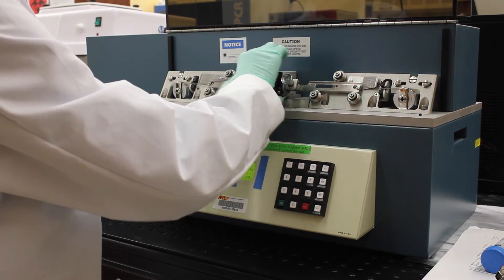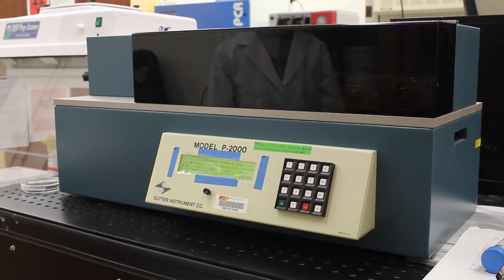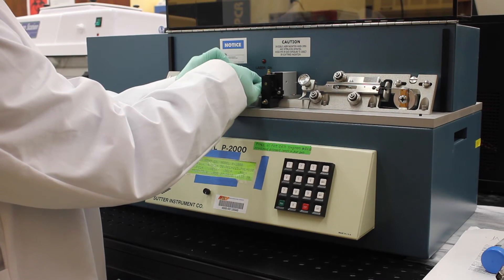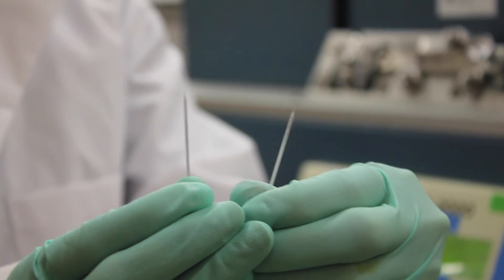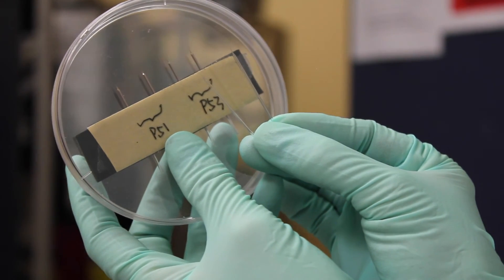You need to make sure it is in place. Then close the lid because there is a laser inside. Now the laser is on. For around one minute, you will hear a loud sound. At that moment, it means it's ready and you will see the laser light turn off. Now you can open the lid and you get two glass nanopipettes. You can see the tip is very sharp — as shown before, around a few hundred nanometers in size. Within one to two minutes, we get two glass nanopipettes. If you want to make it SERS active, you need to deposit gold nanostructures on the surface.